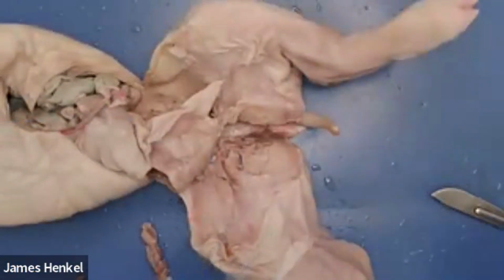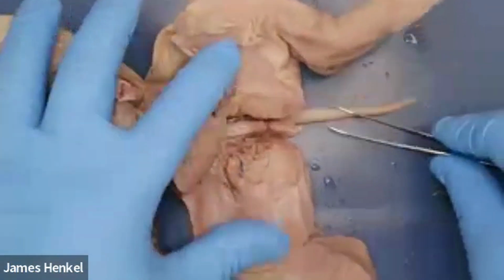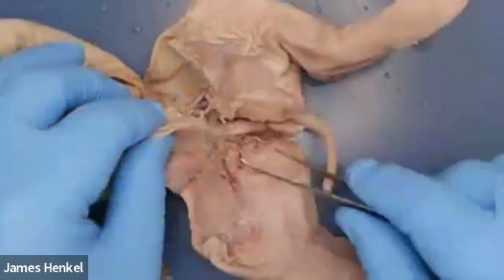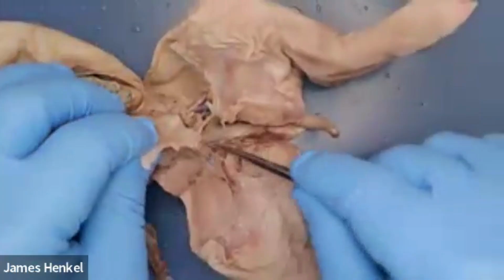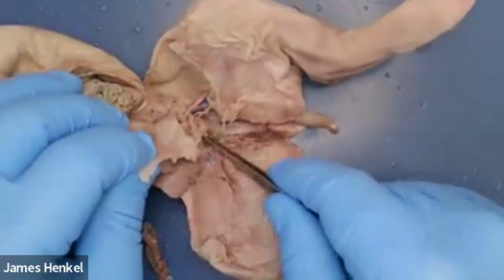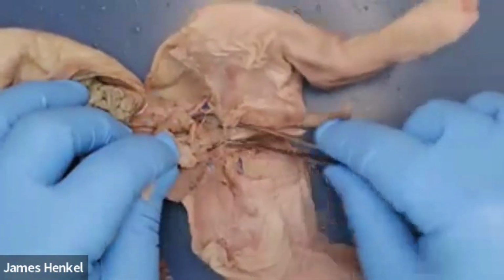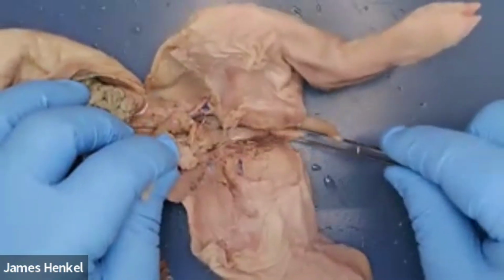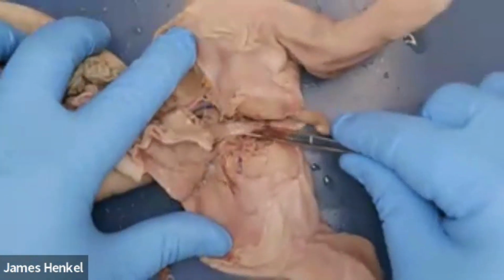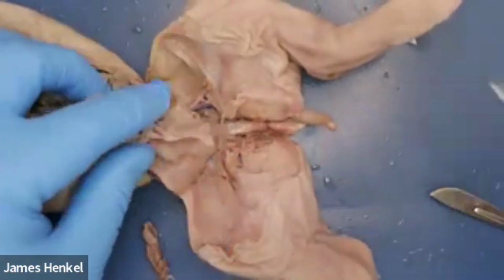So I've removed that pelvic part, and what we can see here is that we have a tube coming out or ending in the urogenital papilla and urogenital opening. And if we clear out enough connective tissue, we can actually find the urethra. This is usually kind of hidden here, but it hooks into the bladder on the other side. And it has a lot of connective tissue holding it in parallel with the urogenital sinus that we're going to take a look at in a bit.